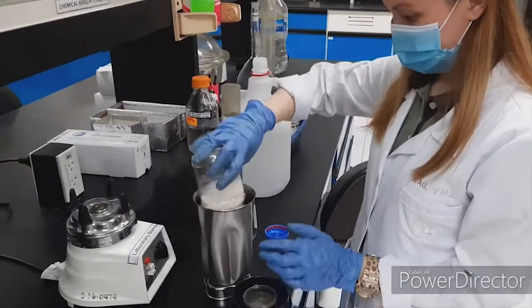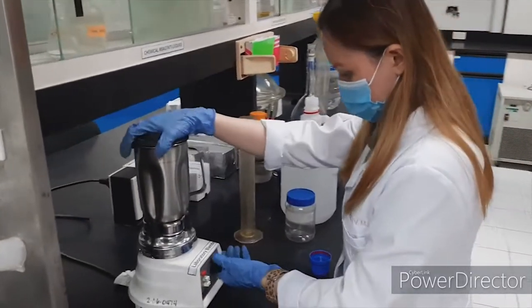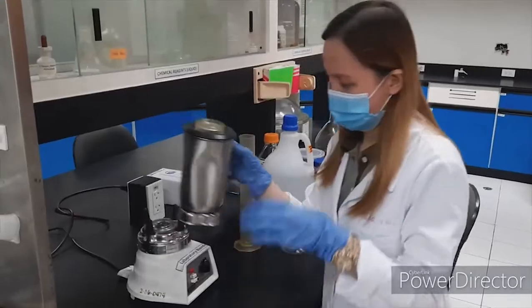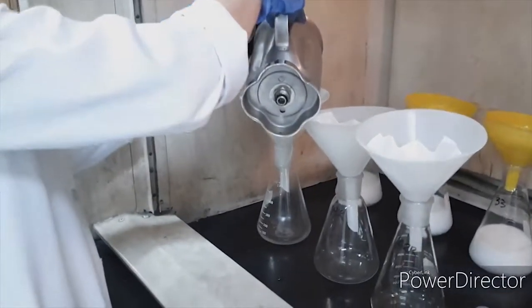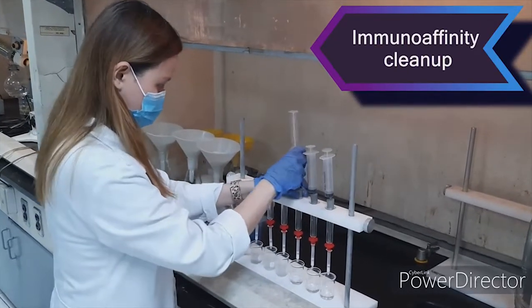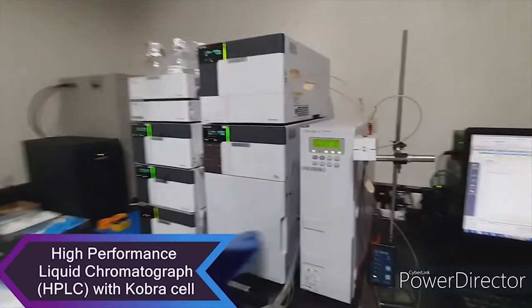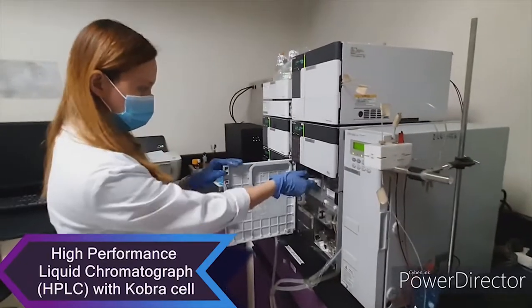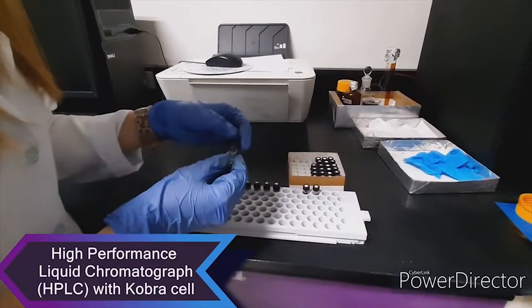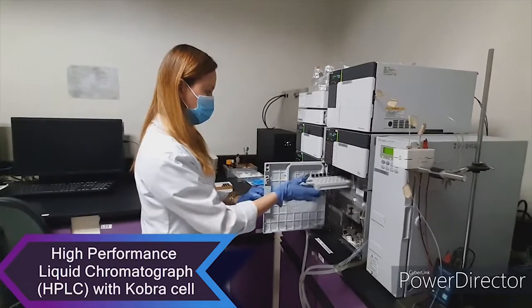For aflatoxin analysis, the sample is weighed and blended with methanol-water extracting solvent. The mixture is then filtered to collect the filtrate, which undergoes immunoaffinity cleanup through dilution, separation, washing, then elution of aflatoxin into clean vials. Samples are then analyzed by reversed-phase high-performance liquid chromatography with post-column bromination through an electrochemical cell prior to fluorescence detection.